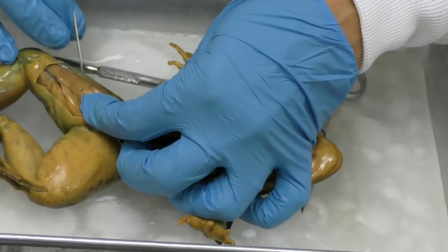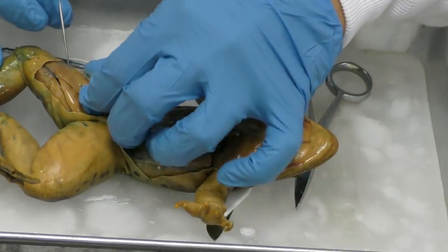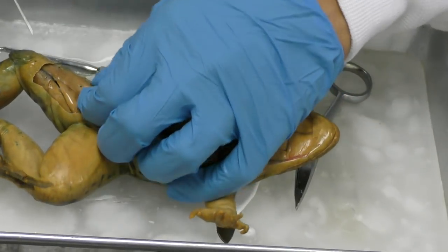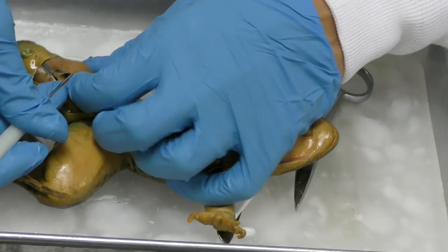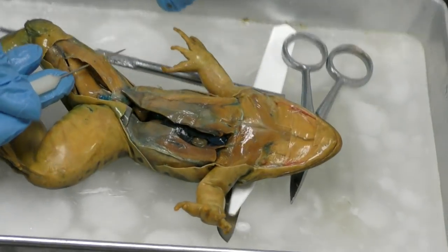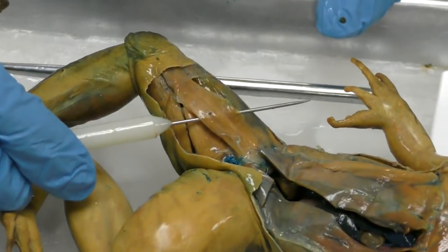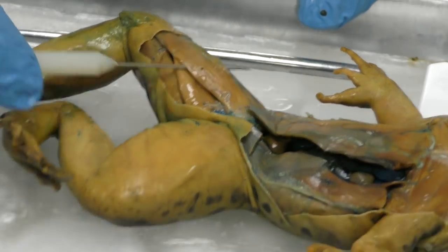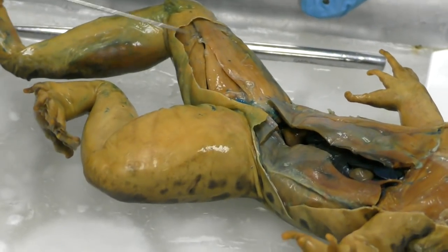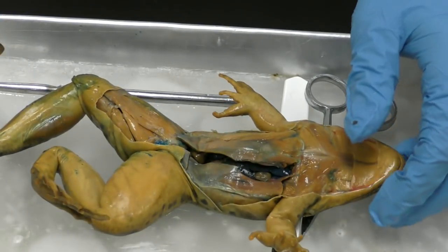Okay, I'm almost there. I'm going to show you a couple pieces. Unfortunately, our videographer had to step out, so I have to do it the old-fashioned way, which is just keep lifting it up to show you. Okay, so here I don't want to say what it is, but here I've separated them out, and you can see the layers of this system. Okay, so take a minute to try to figure out what that system is.